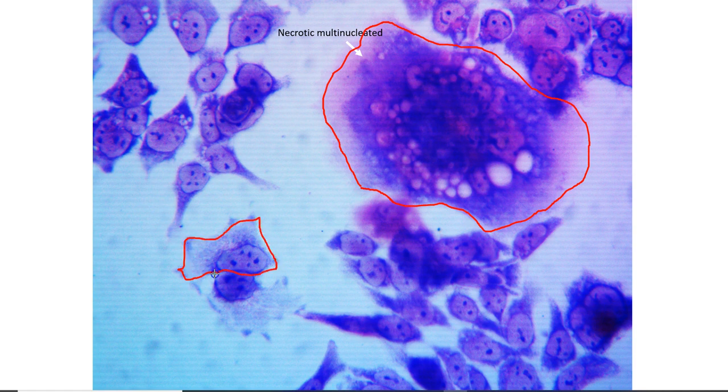Here is an example. This is a single membrane, single nucleus, nucleoli inside, and then here's another one, with the nucleus, nucleoli, typical cell. Other cells in here are clearly stalled.